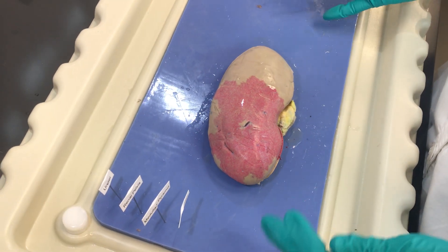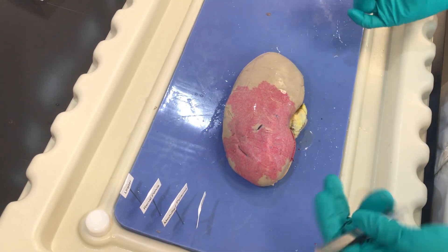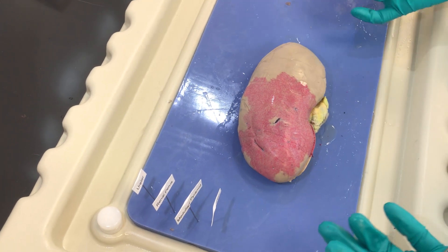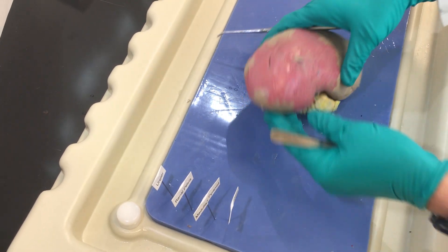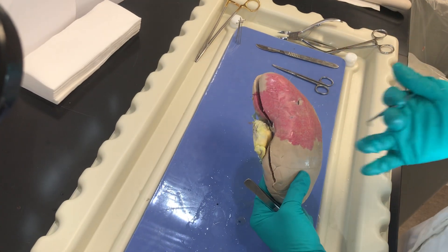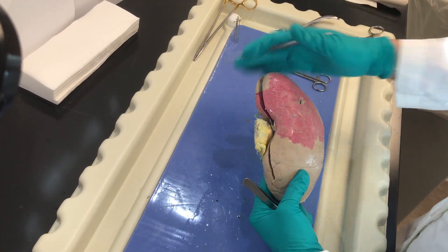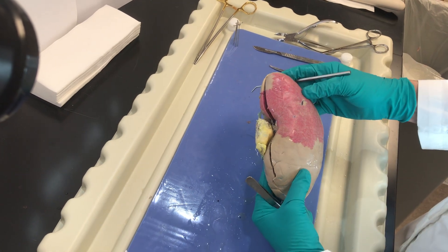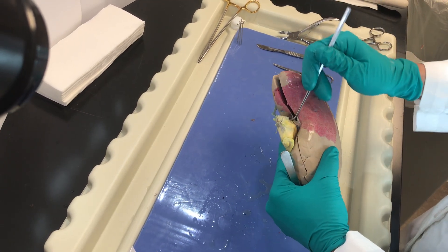Hello students! Today we're going to be dissecting a kidney. This is going to be a pig kidney, and again you want to orient yourself. So if this were in the pig and the pig were facing me this way, this would be superior and inferior, or cranial and caudal in the pig, and this is the hilar area.